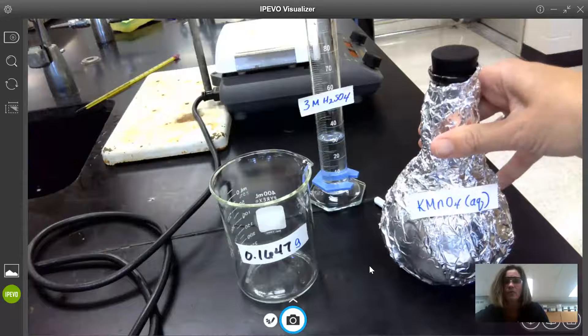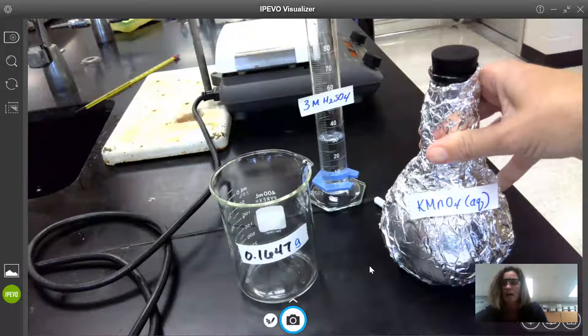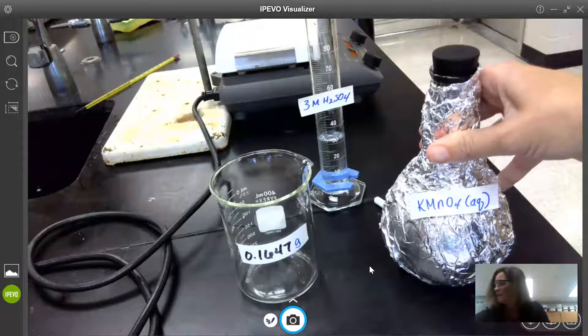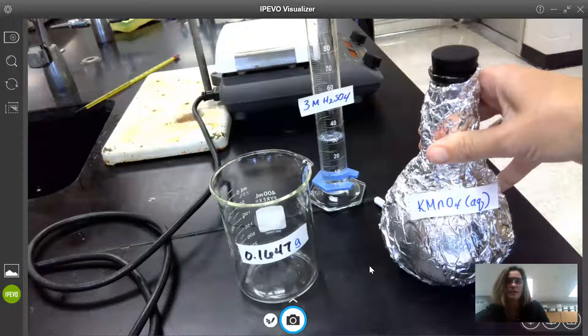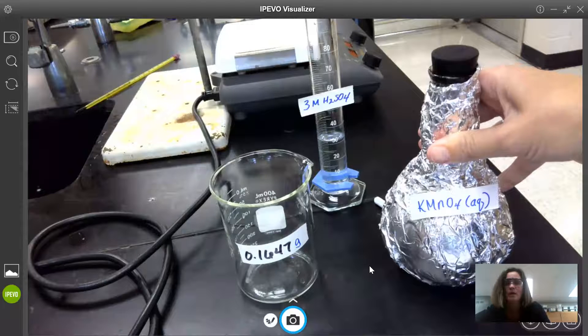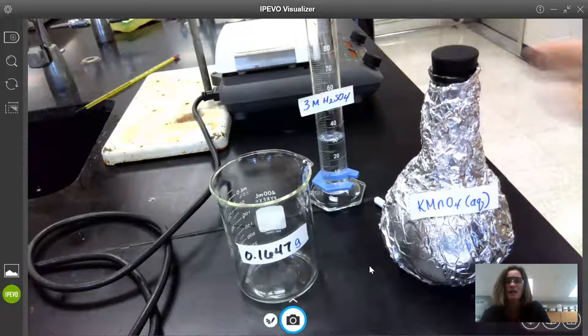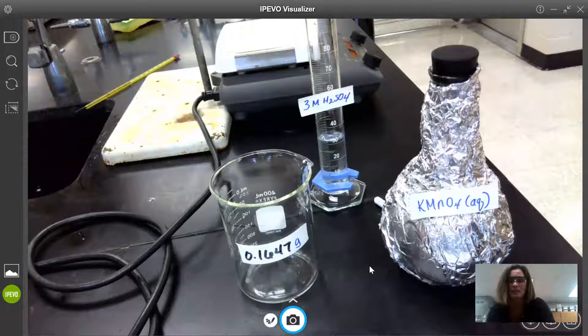So here's our KMnO4 solution which we made up in our last video. Its concentration is approximately 0.02 molar and the purpose of today's experiment is to determine its exact concentration.